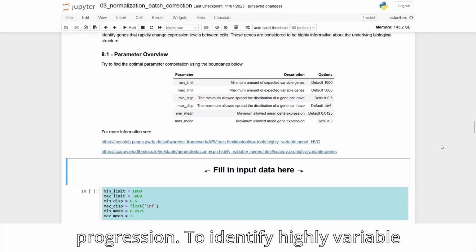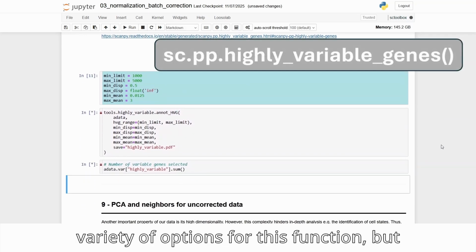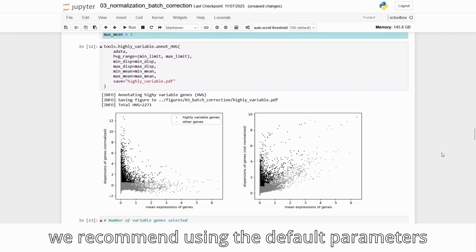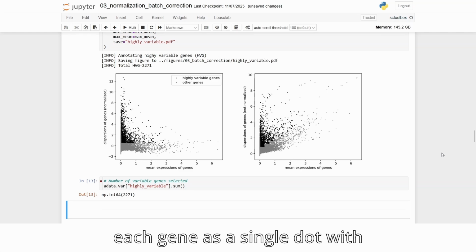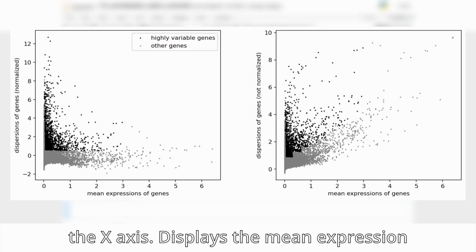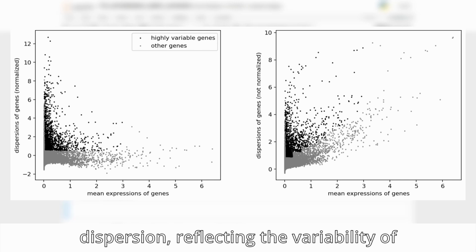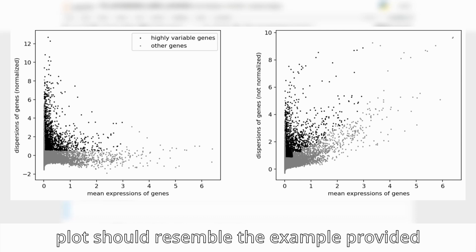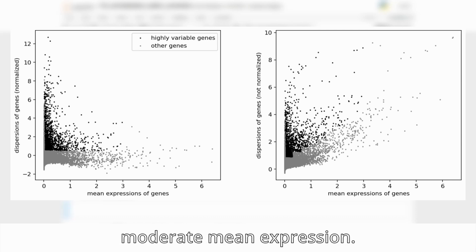To identify highly variable genes, we use the scanpy function highly_variable_genes. There is a variety of options for this function, but we recommend using the default parameters for now. The generated plots represent each gene as a single dot, with highly variable genes visually emphasized. The x-axis displays the mean expression level, while the y-axis shows gene dispersion, reflecting the variability of gene expression across all cells. The plot should resemble the example provided here. Highly variable genes typically exhibit high dispersion combined with moderate mean expression.